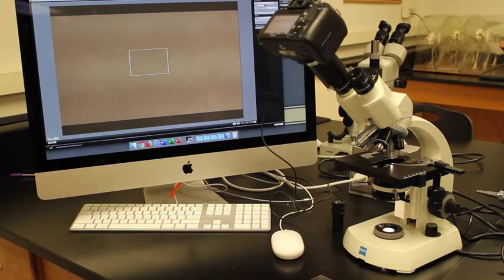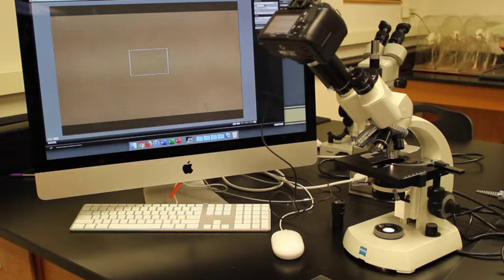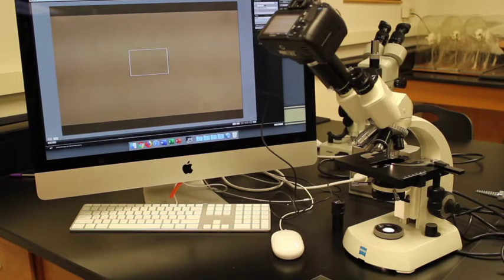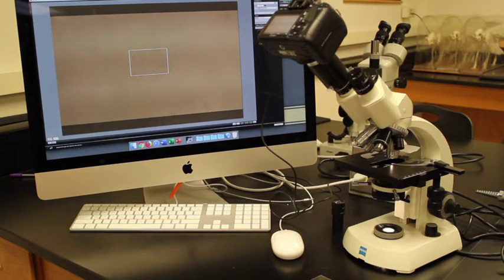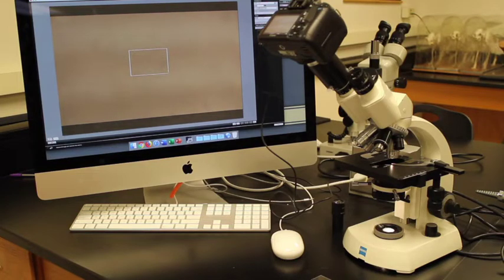The goal of this week's lab is to examine cells. We're going to use the microscope to examine cells and we'll be looking at various microscopic techniques to examine a variety of different cells.